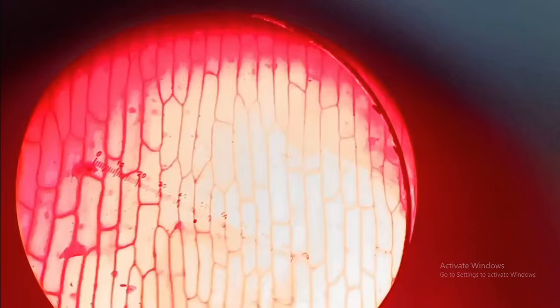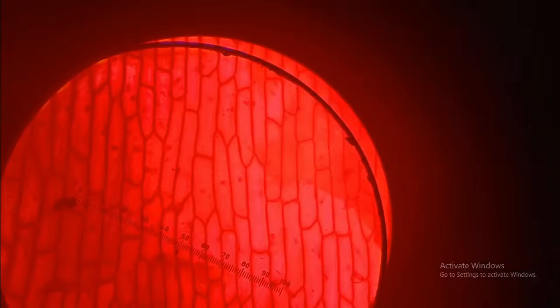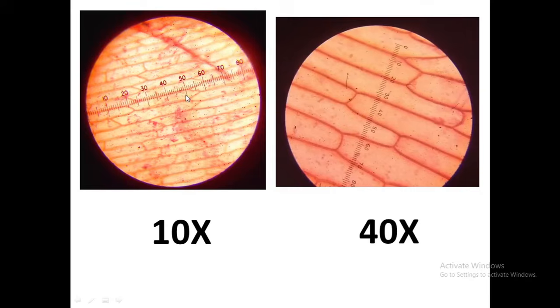By rotating the eyepiece lens, we can orient the micrometer in our required direction. As you can see, we have rotated our eyepiece so that measurement can be taken for the width as well as for the length of a cell.